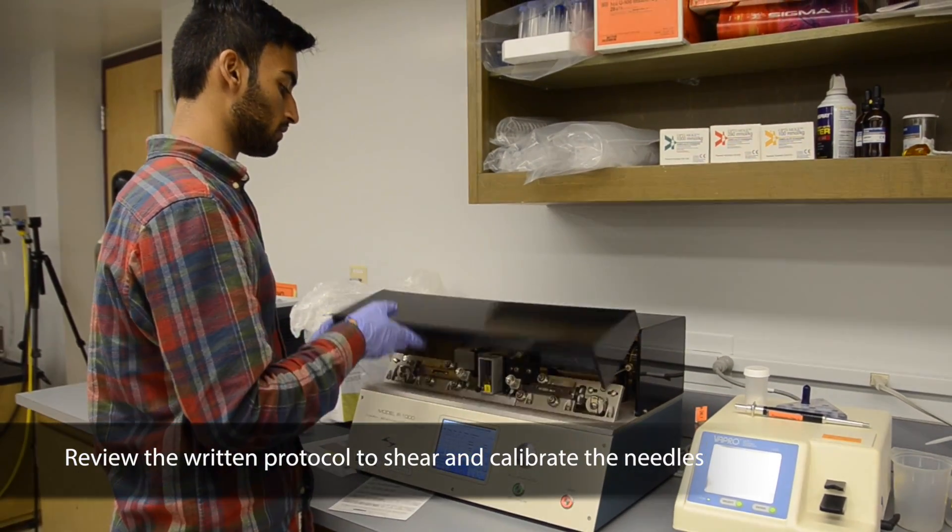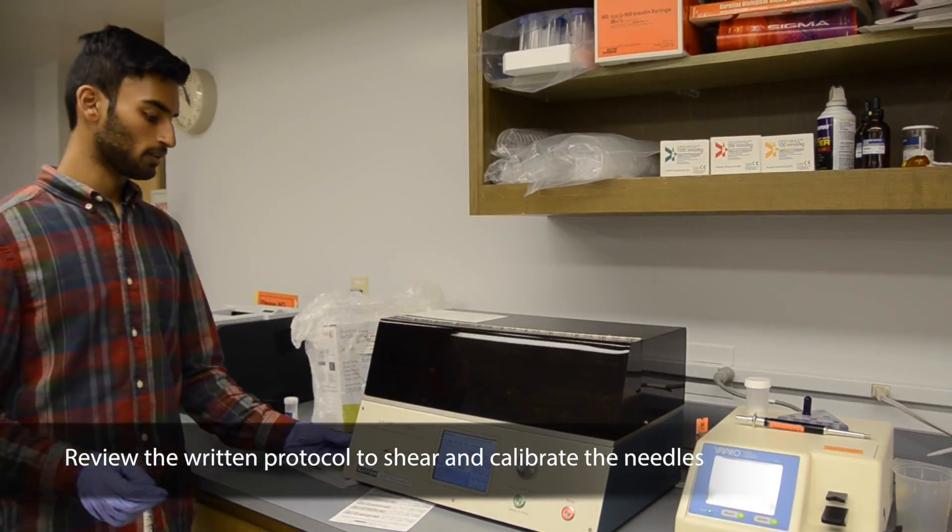Follow the steps on the written microinjection protocol to shear and calibrate your needles.